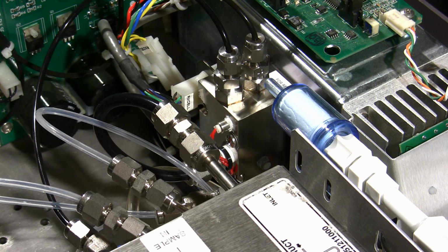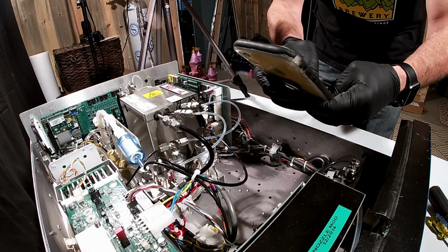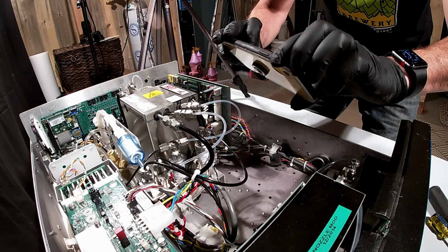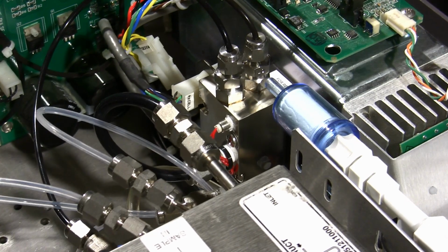So to get started, we've got our instrument pulled out of our rack and the cover pulled off here. Generally what I like to do is get my camera out and take a few pictures of where everything's at from a few different viewpoints, tubing, electronics, so that I remember how to put this back together. There's also plenty of diagrams in the user manual.